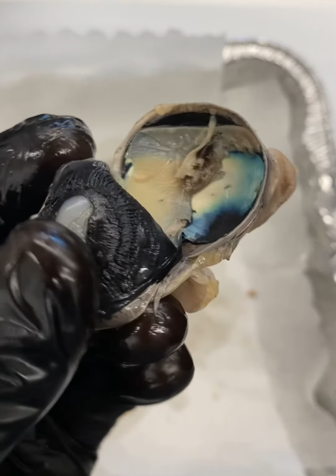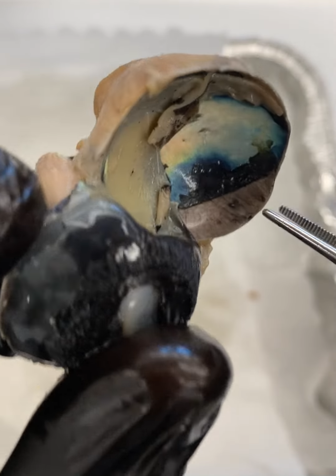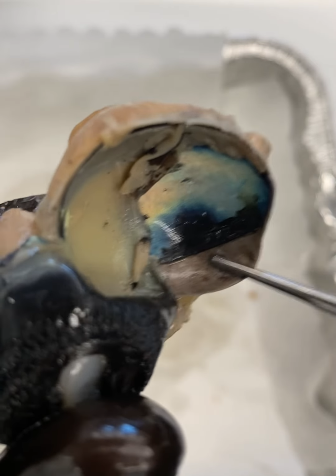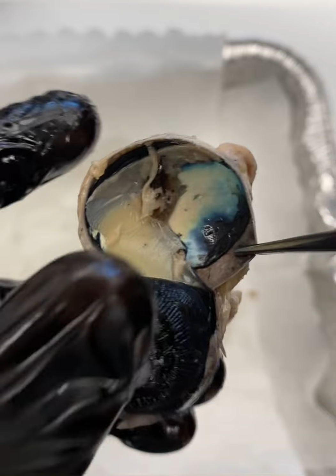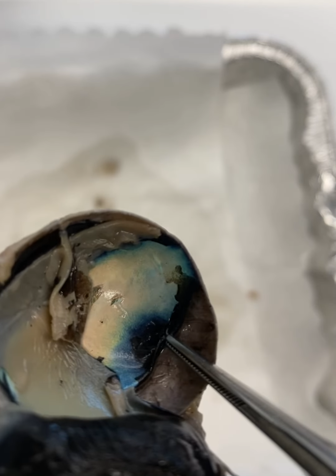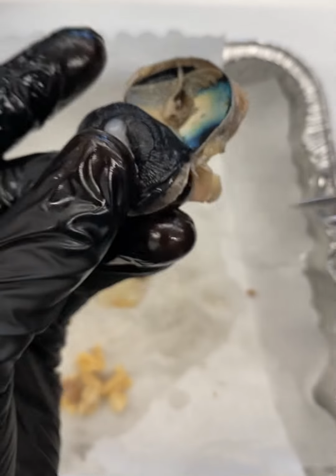So a few things. We'll do a review of some of the layers, right? So this is our sclera, right? If you recall, our thick outer fibrous tunic. This is our sclera that I'm holding here with the probe. Remember, it's continuous with the cornea anteriorly. You have this dark region here. This is what's called the choroid, okay? The choroid right here.